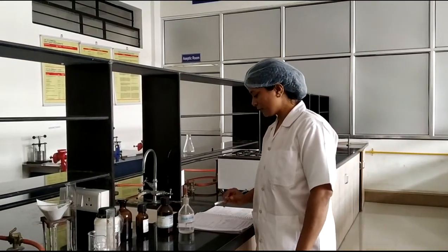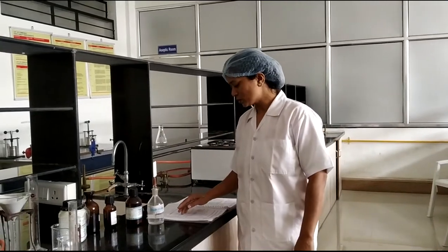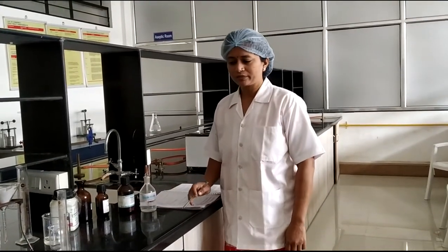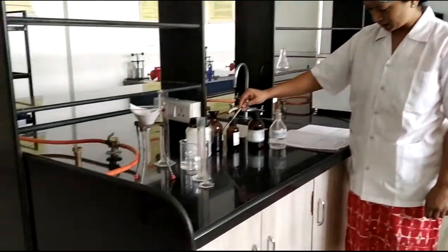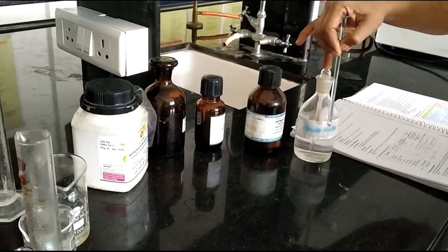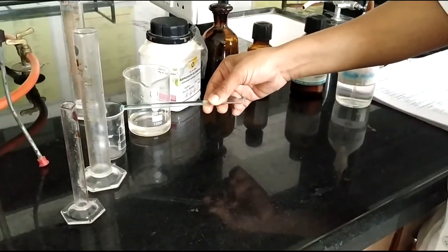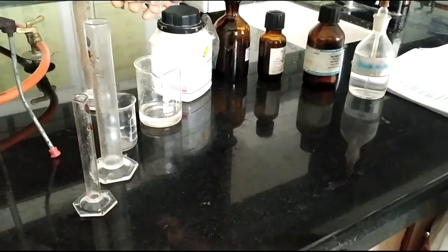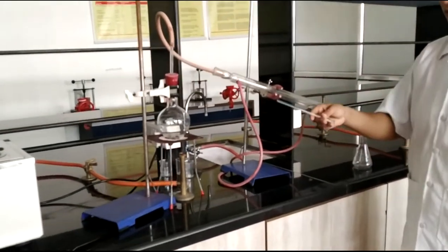Welcome to the pharmaceutical first laboratory. In this session we see how to prepare 100 ml of Aromatic Spirit of Ammonia IP by the distillation method, also having the synonym Spirit of Sal Volatile. The ingredients include ammonium bicarbonate, ethanol 90%, lemon oil, nutmeg oil, strong ammonium solution, and purified water. The apparatus includes a burette, measuring cylinder, and distillation assembly.